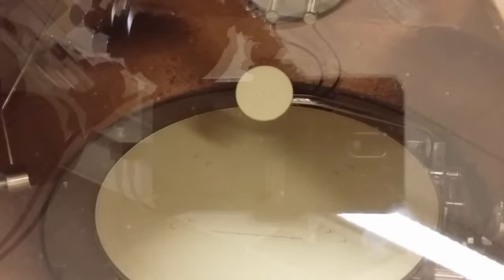So this is the viewing screen in the microscope. You can also see that there are two screens: one smaller dish atop the bigger one. The smaller dish is used for the binocular view and the camera view in this setup. For the current demo session, we turn off the small dish. So now we only have the big dish exposed to the electrons.